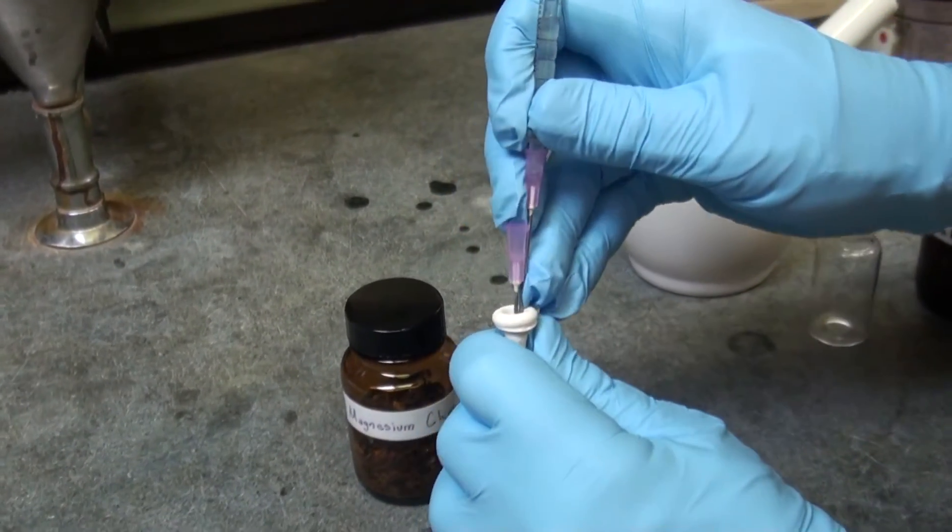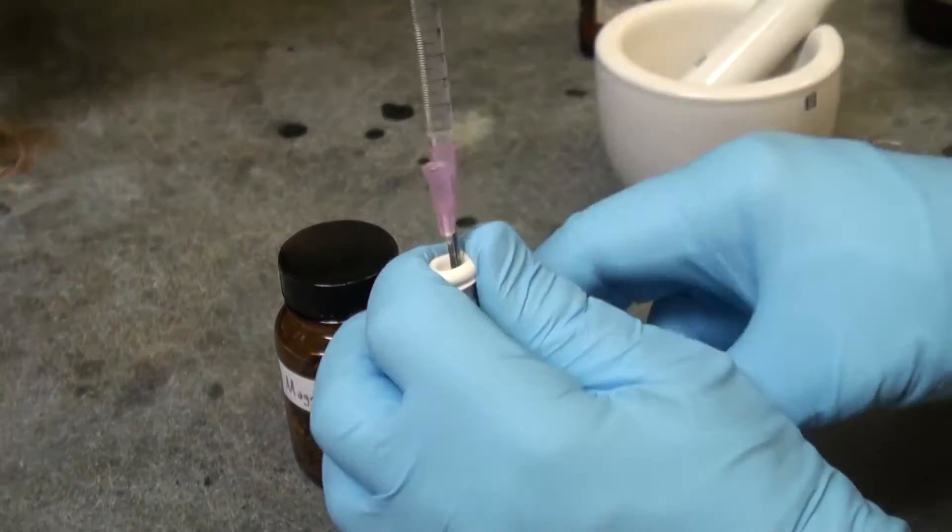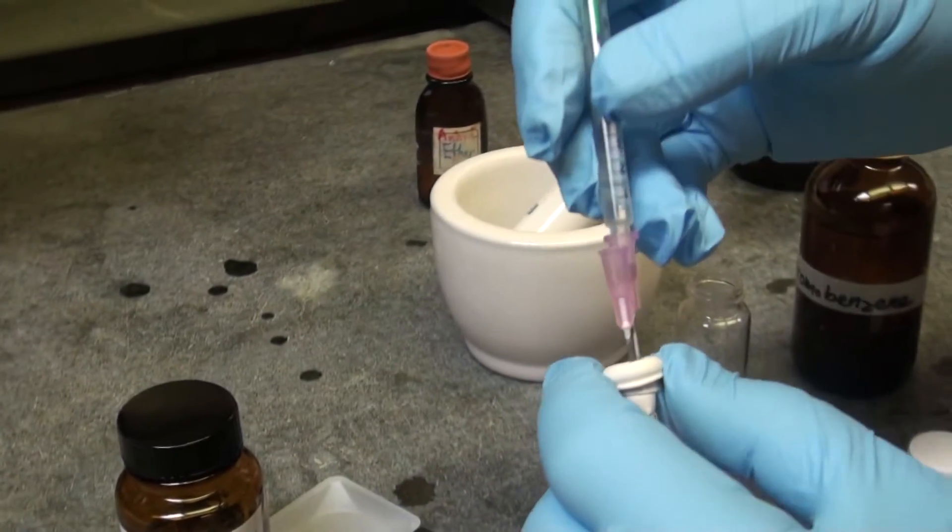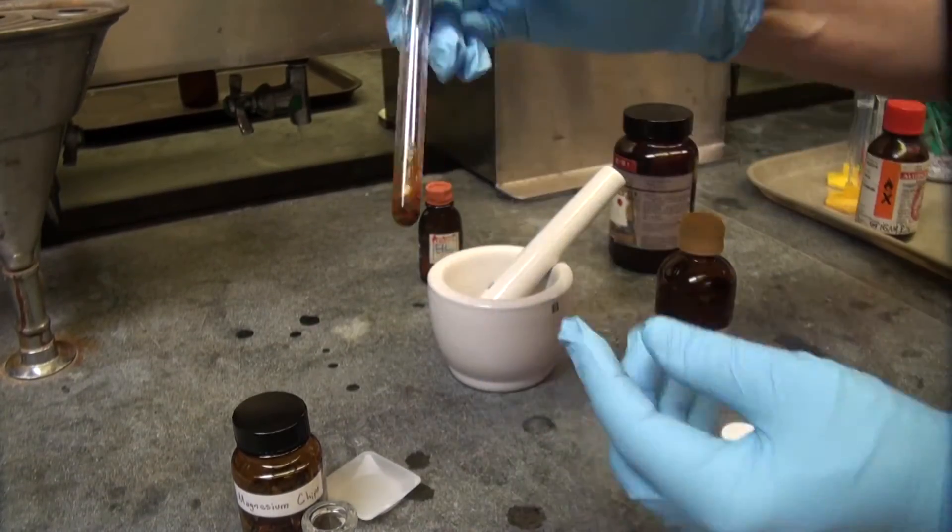And that's what you have to add to the magnesium in ether with iodine. When you squeeze the needle through the septum, you have to hold the septum on the side.